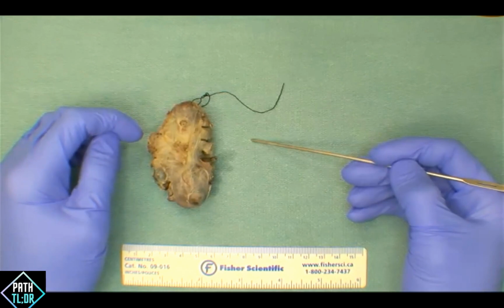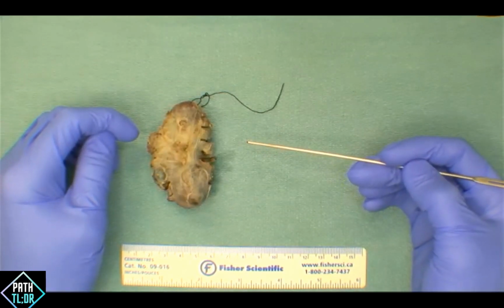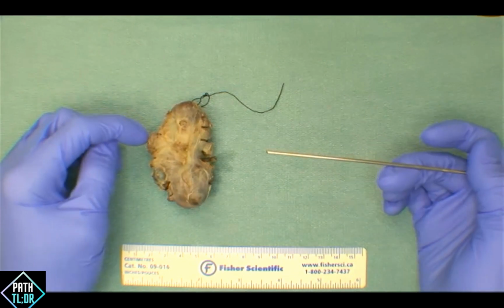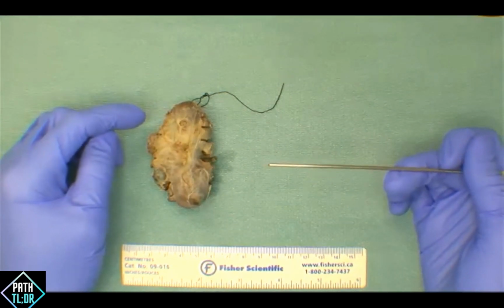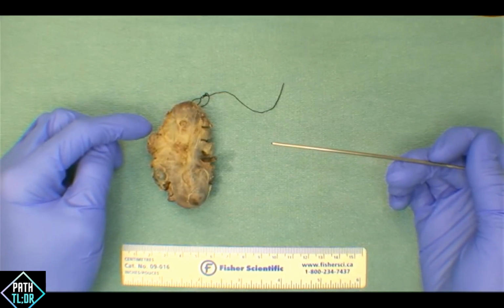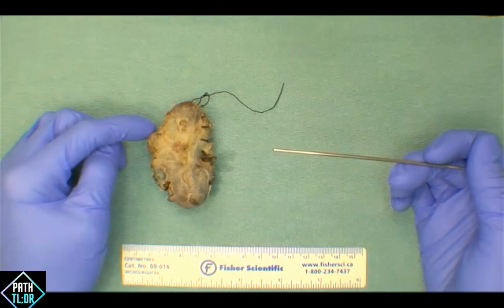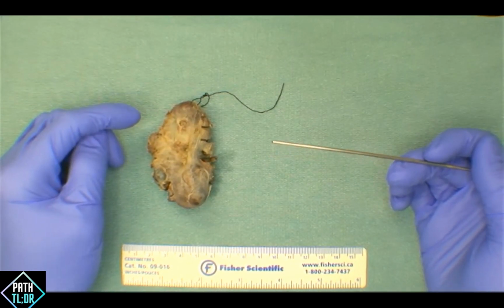Okay, so maybe a question related to the pyramidal lobe. What anatomic structure is that pyramidal lobe related to? Anybody know? The pyramidal lobe. Yeah, excellent. It's the thyroglossal duct. Does anybody know what percent of the population has this pyramidal lobe? Yeah, anywhere between 10 to 30, depending on where you're reading. So you do see it occasionally.